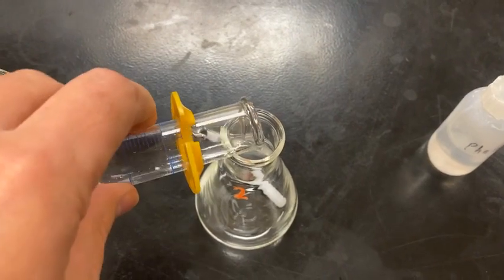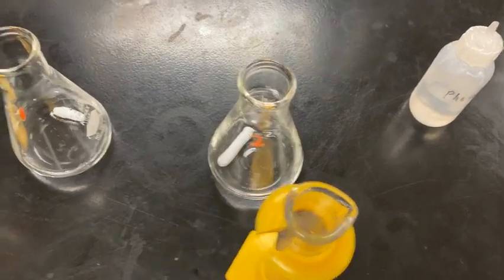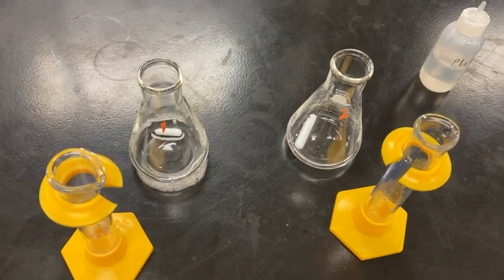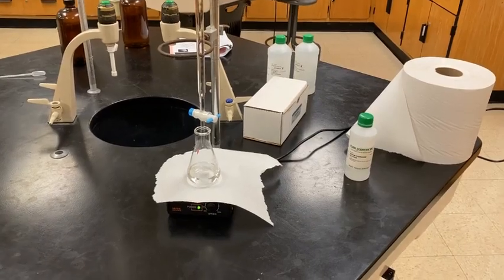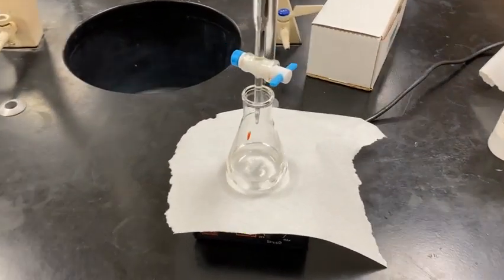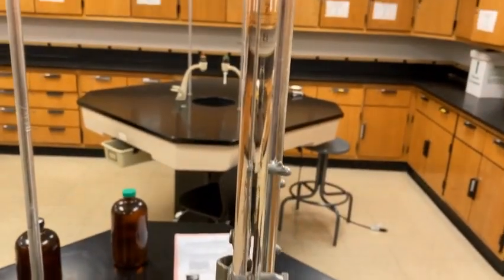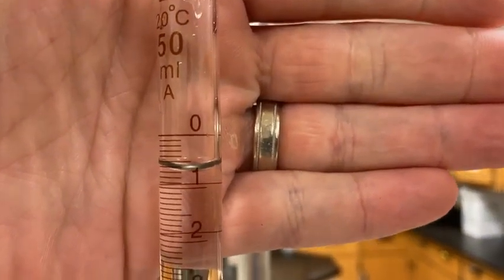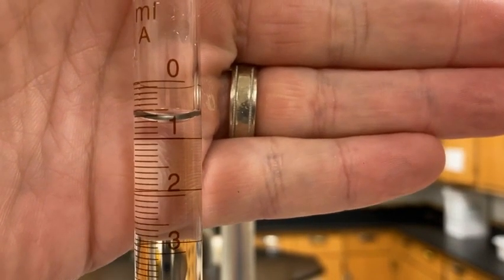And then what I'm going to do also is add distilled water like we did in past titrations. That'll just increase the volume. It does not change the number of moles of acid that I have floating around in there. And I'll also add 2 to 3 drops of the phenolphthalein. All right, so I added the water and drops of our indicator, and then I set up sample 1's underneath the burette. Got a little stir bar, mixing it, and then let's go ahead and get the initial volume reading for our 0.1 molar NaOH. Let me get a little bit more even. Okay, go ahead and get that volume. Watch your increments again.